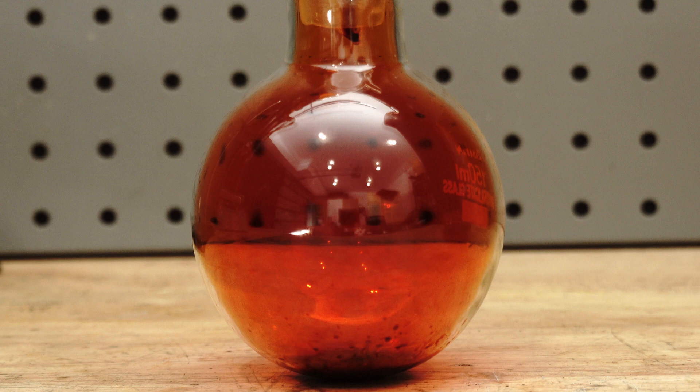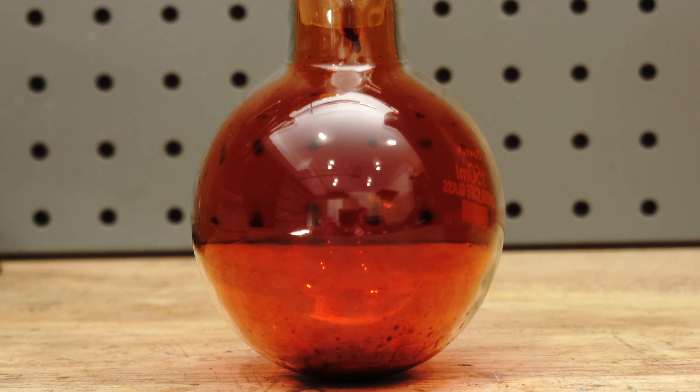This Bromine is relatively pure, but it's still mixed with water and that's not what we want. So we purify this in later steps.